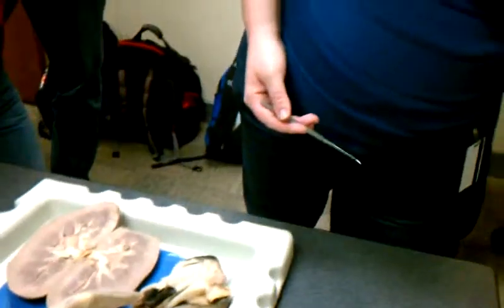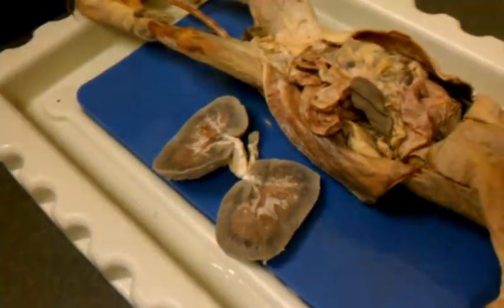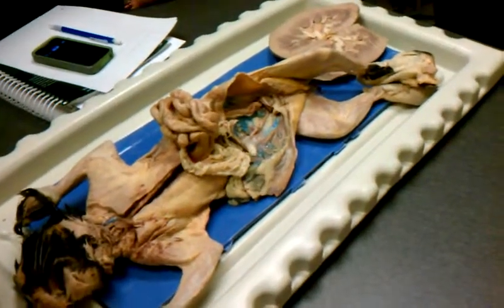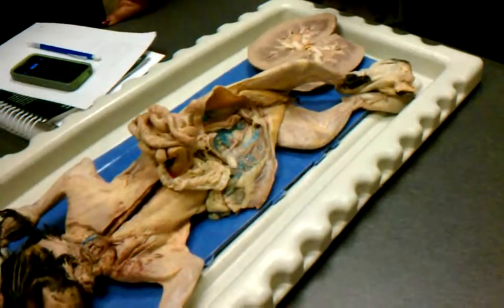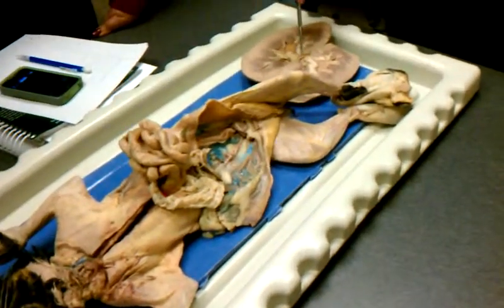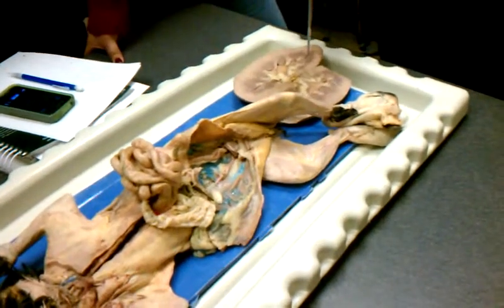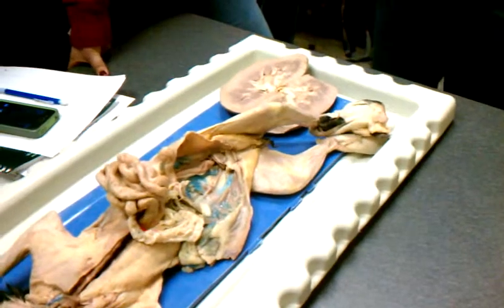And you said you're going to try to be careful on the pinning line when it comes to the pelvis and when it comes to the hilum? The hilum, yes. So if I were to ask you for the hilum, I'd probably have to have some sort of bracket or something for this whole indented area, versus if I stick a pin right in here, that's going to be pelvis. Okay.